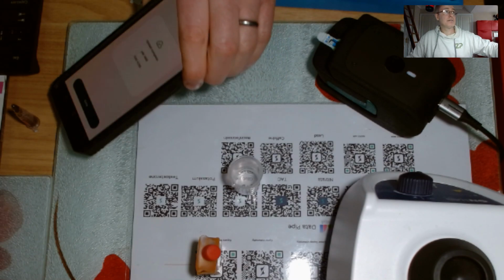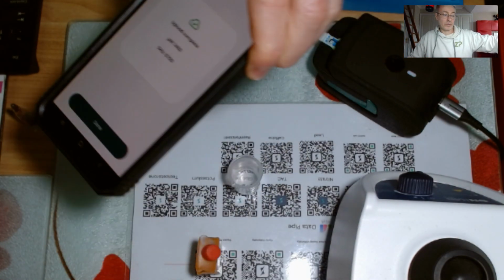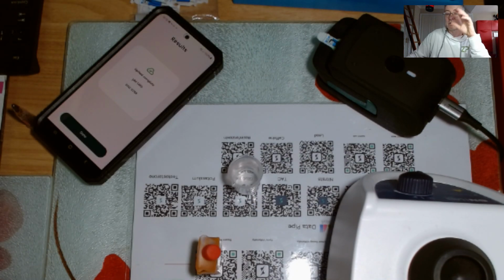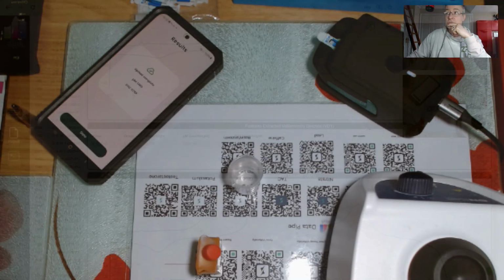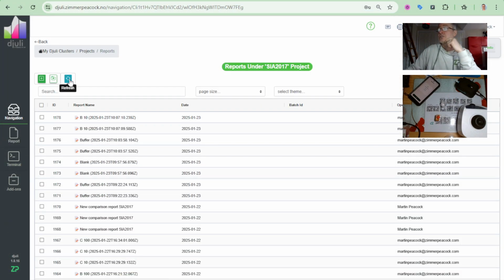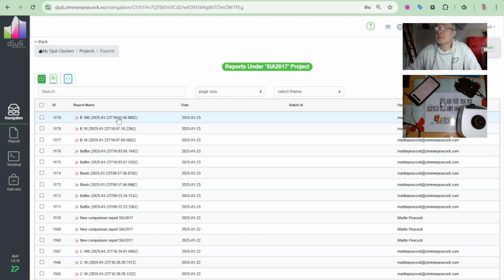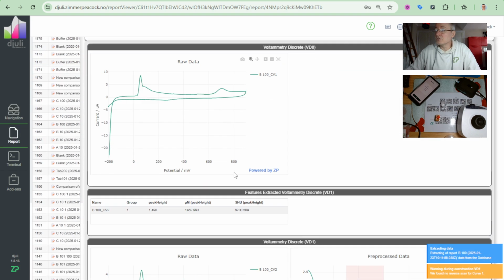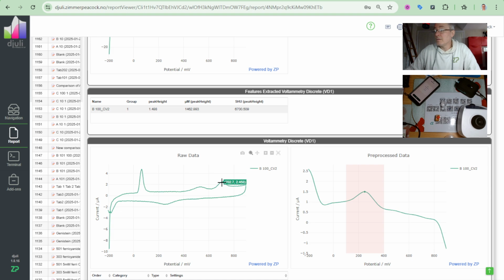And it's come back at 6,700 Scoville heat units. So what I want to now do is just show you what that looks like. So let me just think quite aloud to myself. I'm just going to go to screen 2. I'll just go into reports. I'll just do a refresh, and I will just look at this B100, and then I can sort of see my peak 1, peak 2, and peak 3.